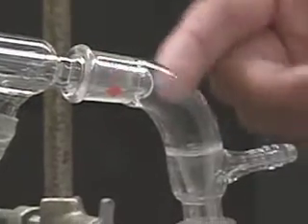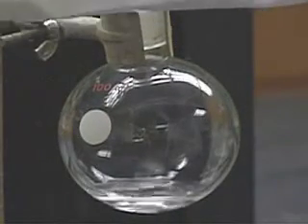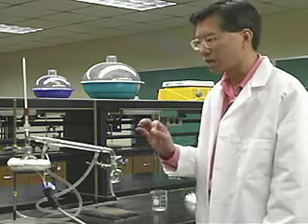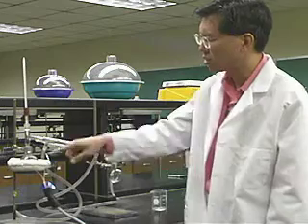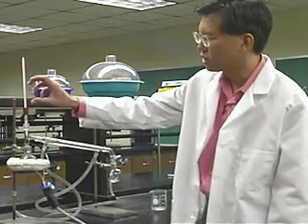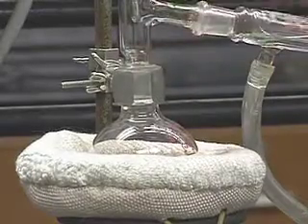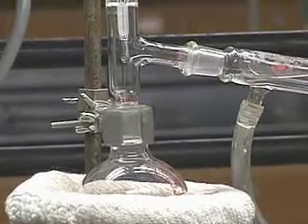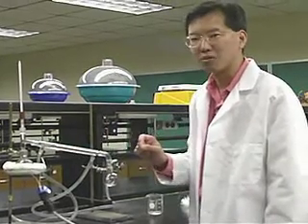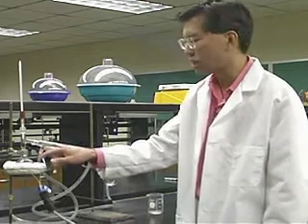When it hits the cold region of the condenser, it starts to condense. As the vapor makes its way through, it gets colder and colder, so it condenses more and more — hence the name. Eventually it comes out the end, goes through this adapter, and drips into our receiving flask. What are we doing? We're effecting a separation: we have solid and liquid on this side — magnesium and ethanol — and on this side we have just the pure ethanol. If we were trying to separate two liquids, we could do the same thing. Provided their boiling temperatures are not too close together, the lower boiling fraction should come off first. We may need to add another straight segment to give us more theoretical plates for better separation. If separating two liquids, it's a good idea to stir with a magnetic stirrer, or add a boiling stone or bumping chip to prevent superheating.